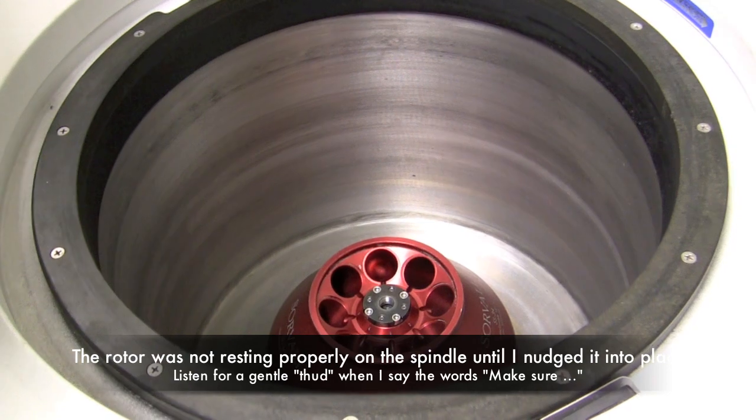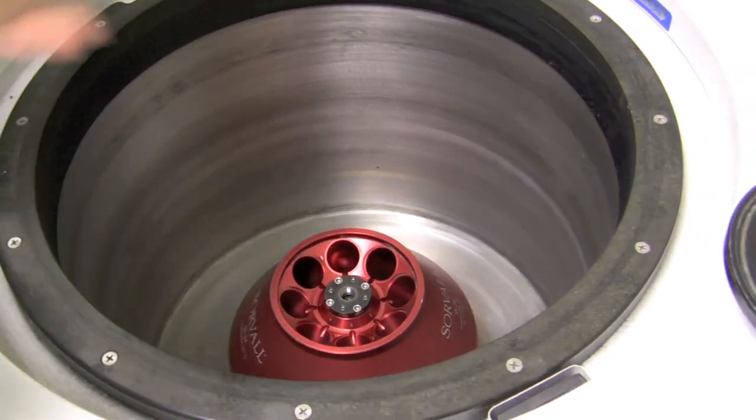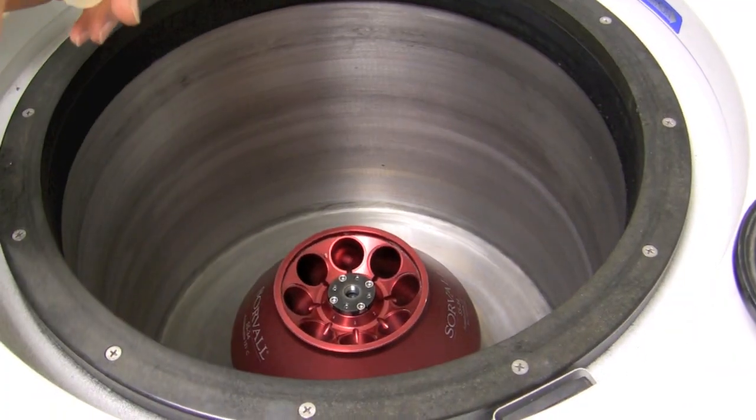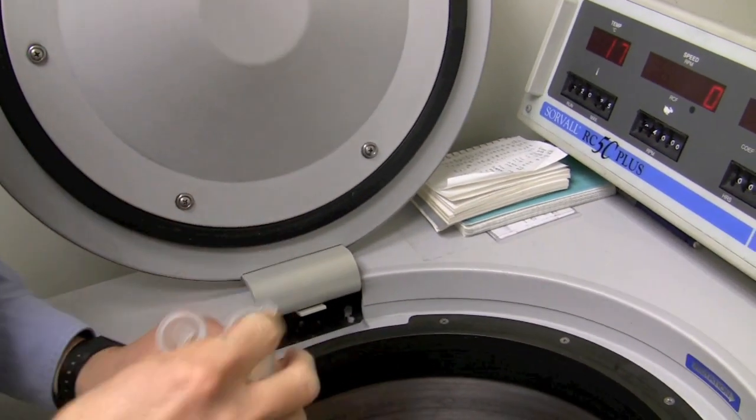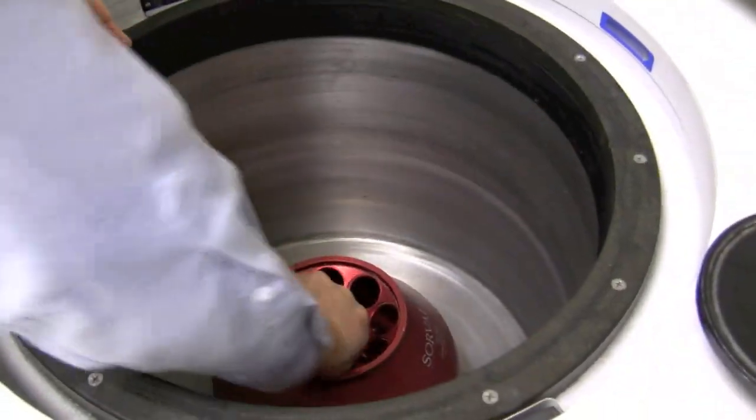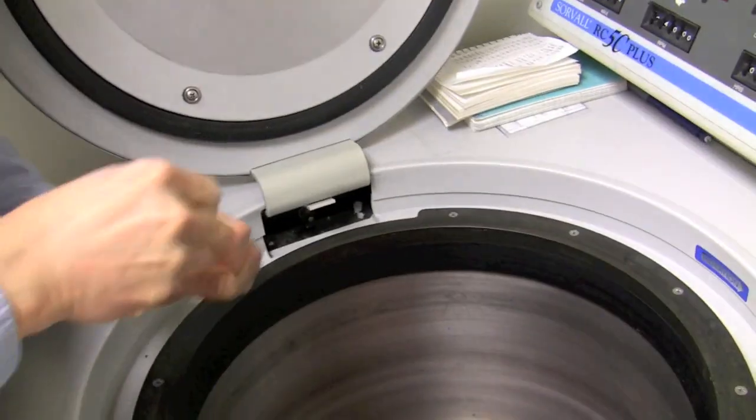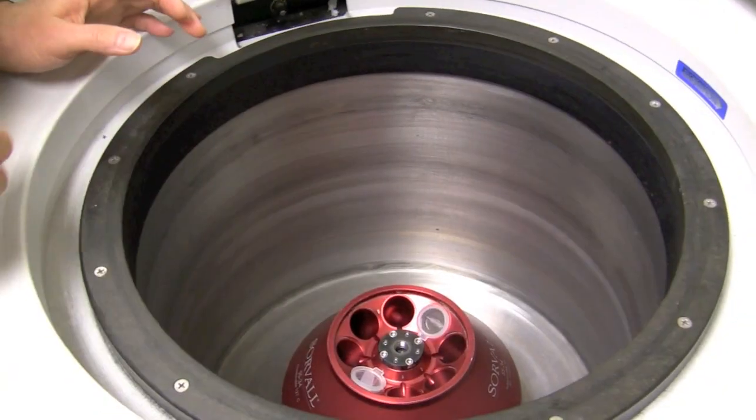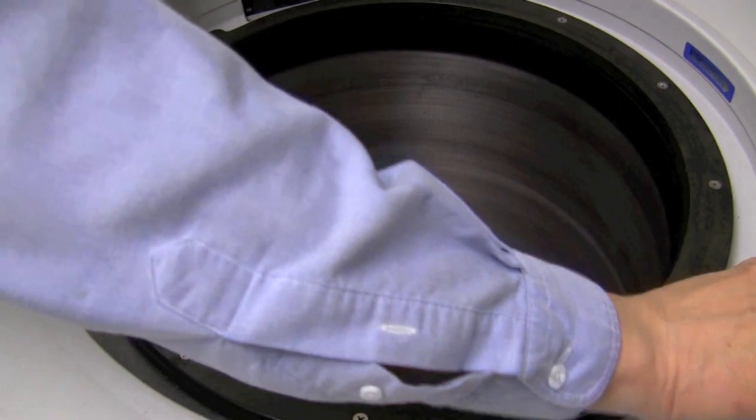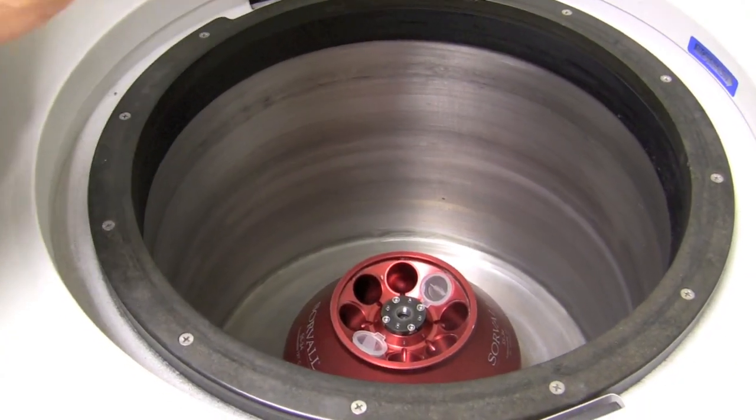I've got my samples here, and I like to put the samples so that this piece over here faces inwards, so like that. Here's the second one. Okay, balanced against each other, and now I'm going to put on the lid.